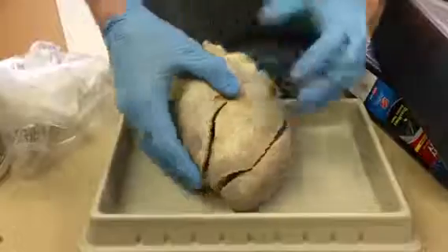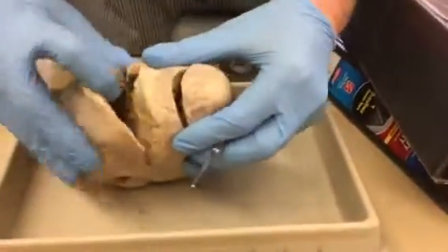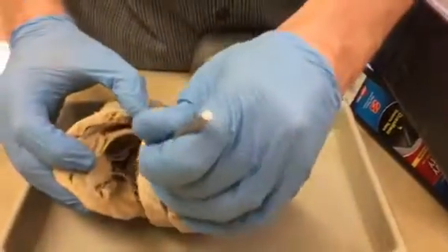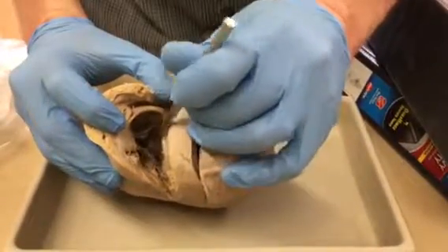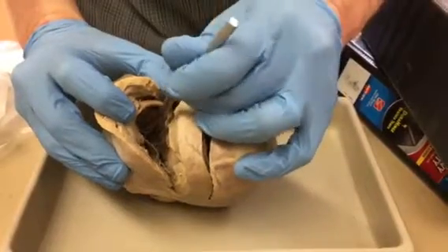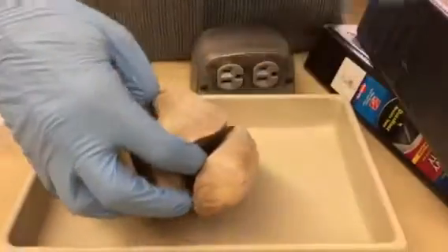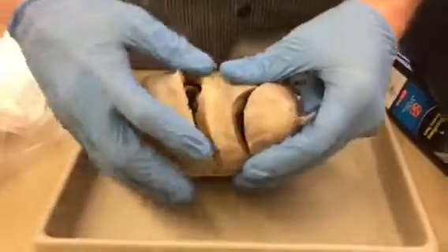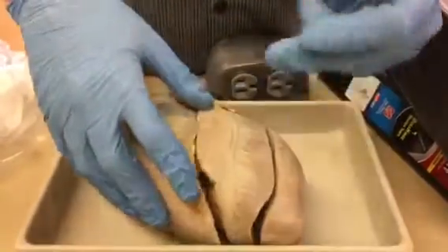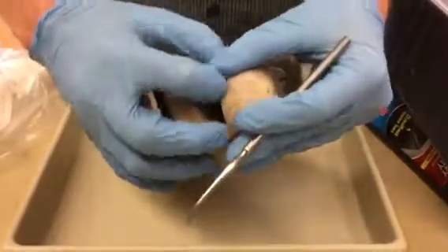Okay. Then the heart valves obviously are pretty straightforward if you know what side you're on. So to find the right AV or tricuspid, you just look in here and you find, and you can even count the cusps, one, two, three. So that's the tricuspid, and you can call it tricuspid or, not mitral, sorry, nope, tricuspid or right AV valve. And I like to just call them right AV valve because it tells you exactly where it is and where it's going. Right. So it's fine to not use the slang terms.